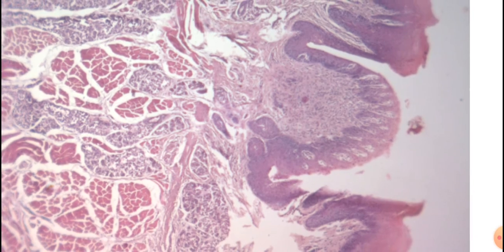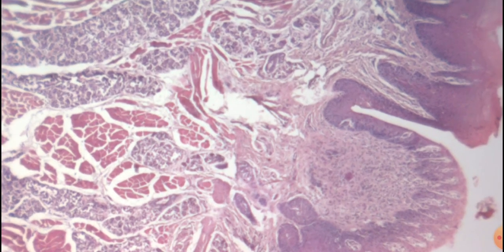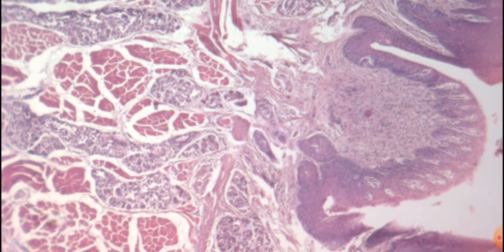Now in the floor of the circumvallate papilla, you can find out there are the number of glands. These glands are the glands of von Ebner. Serous type of glands are seen here. These glands open here into the circular sulcus by the ducts. Along with the glands, what other structures are seen here? Now this is the lymphoid tissue present in the posterior 1/3 of the tongue.